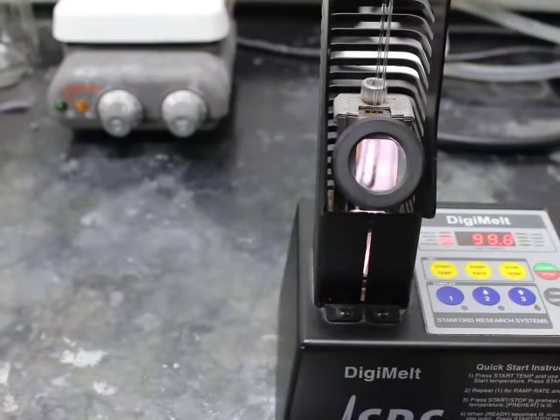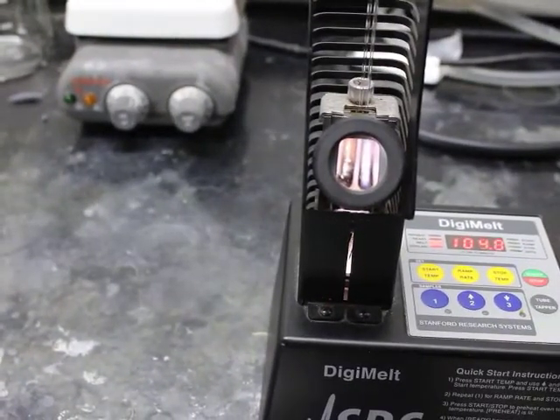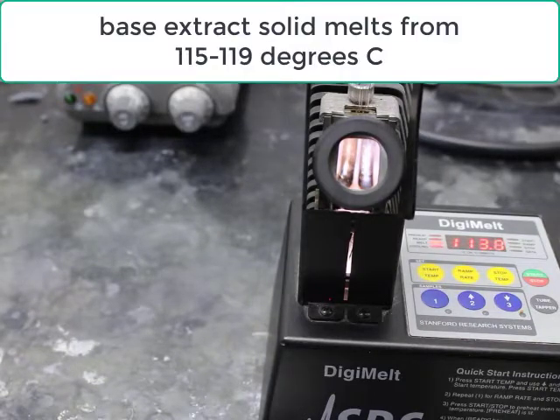Now moving on to the next one. You can see our temperature reading is already about 103. Pay attention to the far right tube, not the middle tube. The far right tube, you can see it starting to wiggle a little bit, and so the base extract melts from 115 to 119 degrees C.